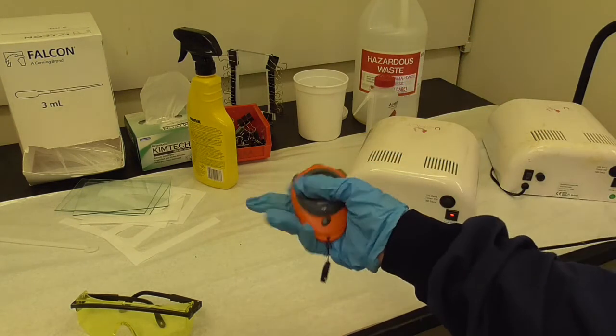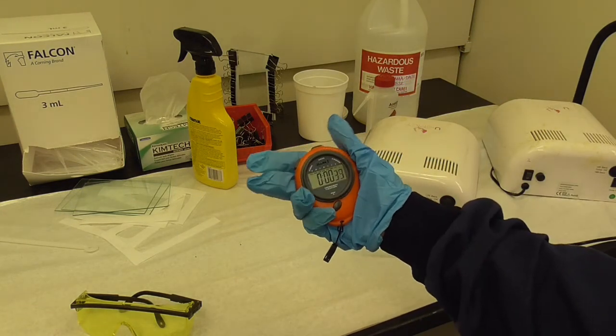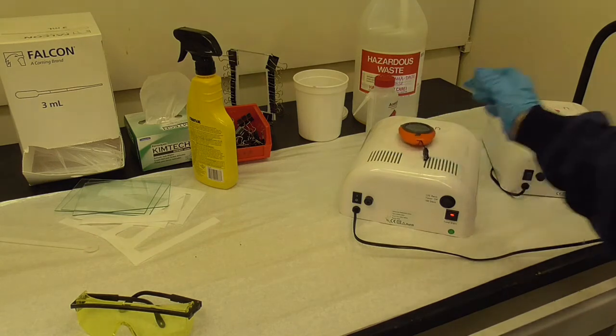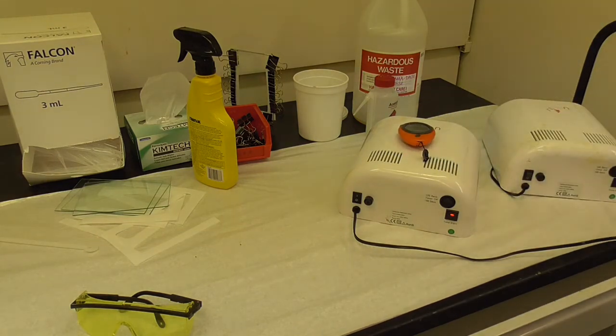Then you want to time it for 20 minutes. That's how long it takes to cure the polymer so we'll check back in 20 minutes.